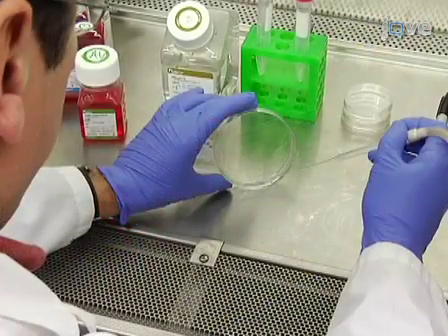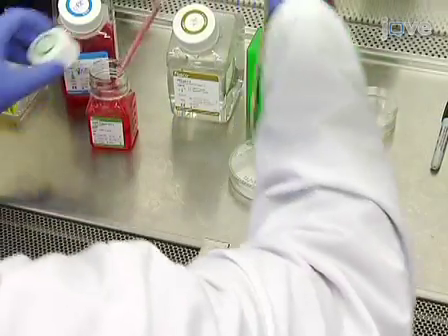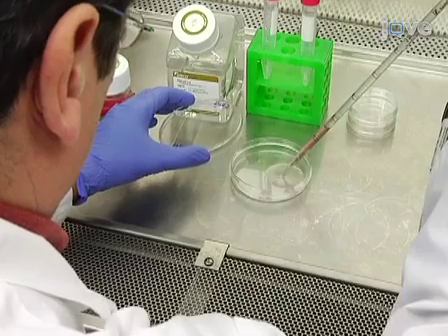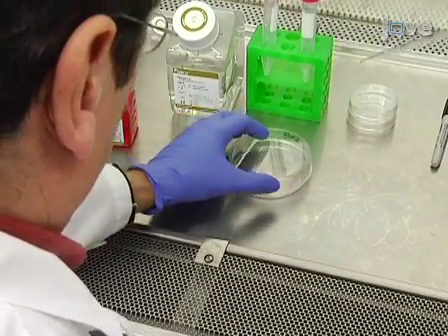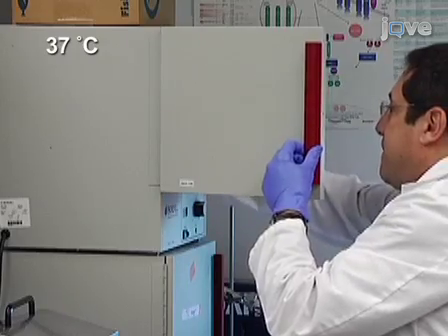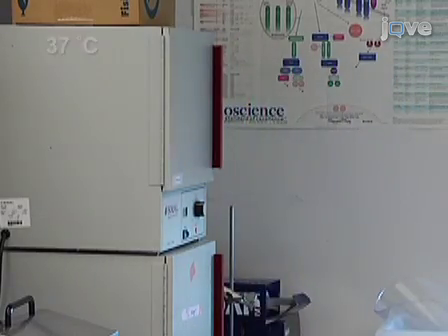Then, aspirate the PBS and pipette 2ml of 0.05% trypsin EDTA solution onto the monolayer. Place the plate into the 37°C tissue culture incubator and incubate until cells detach.